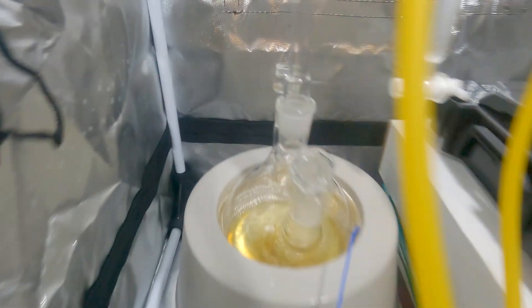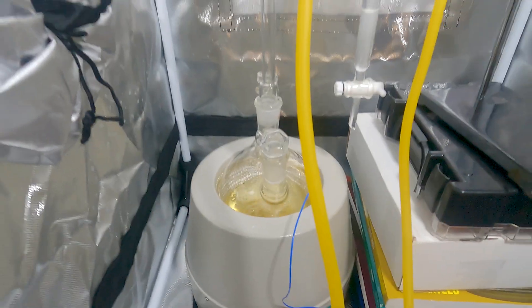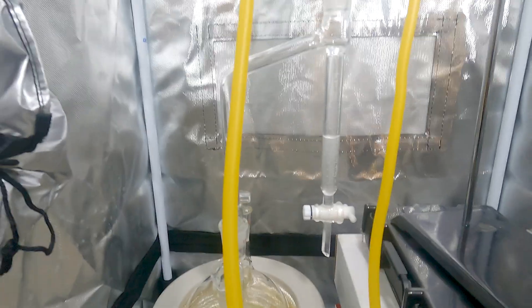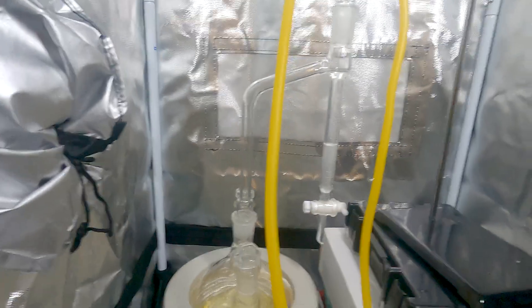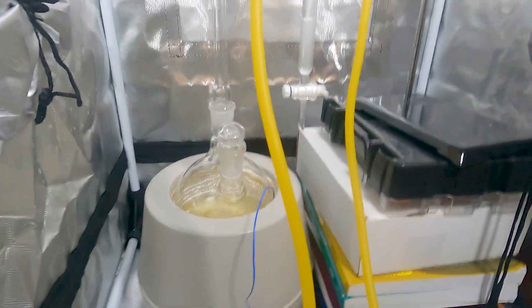About an hour and a half in, yellowed a little bit more down there — not too terribly bad. The water coming over is definitely slowing down, still running at a minimum of 4 hours, but things are going well. And someone stole our Dean Stark Shrine, so please pray for Dean Stark.